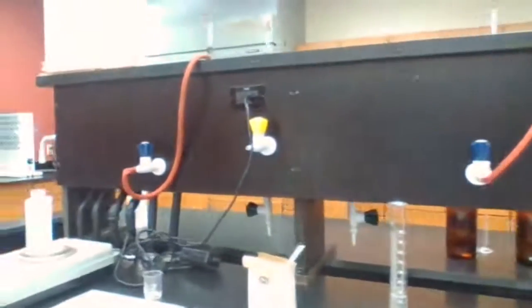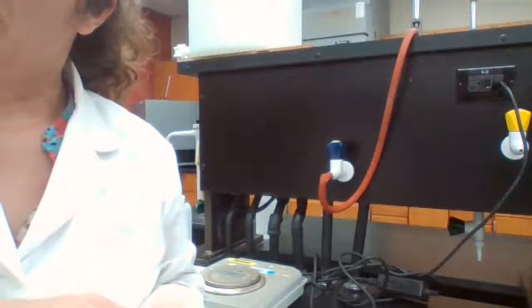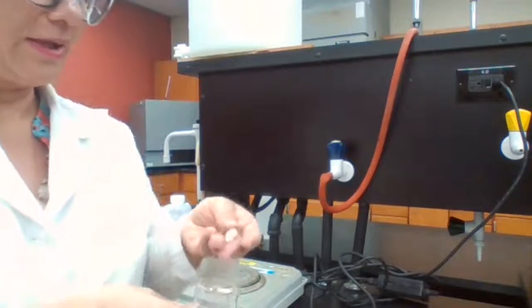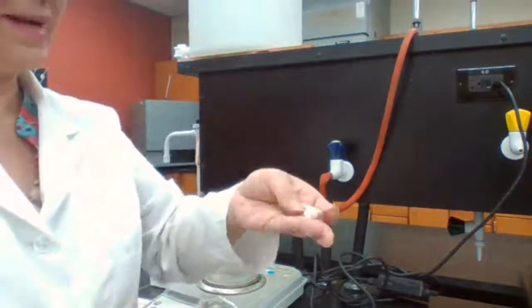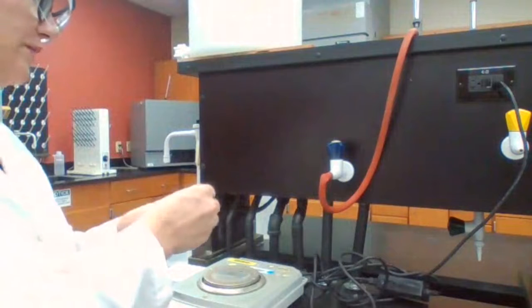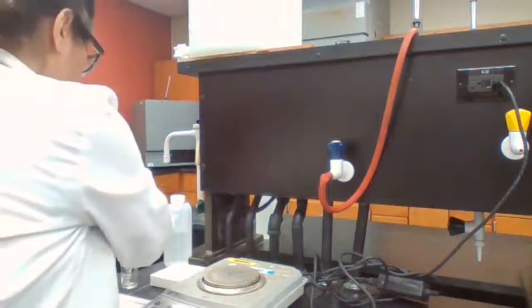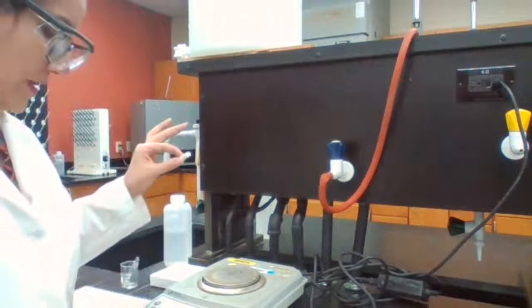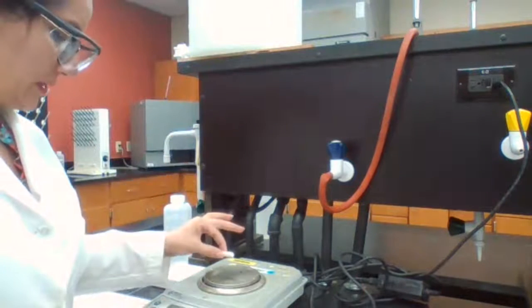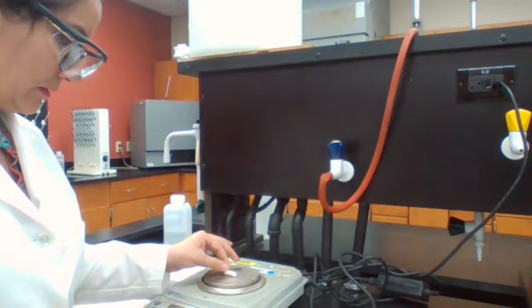Station 4, we have a piece of chalk. So we have a piece of chalk, which is calcium carbonate. The chalk is calcium carbonate. The mass of this chalk probably is different from what is written here, but we want to know moles of the chalk first. And for this one, we have to measure the mass of the chalk. So 0, going to give you the mass of the chalk by measuring the chalk.